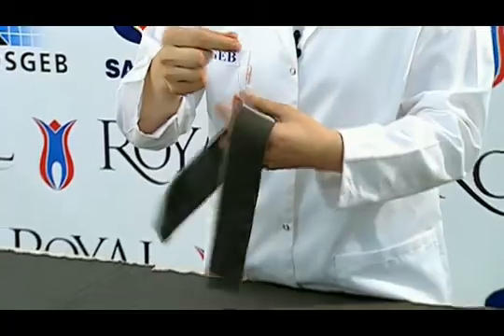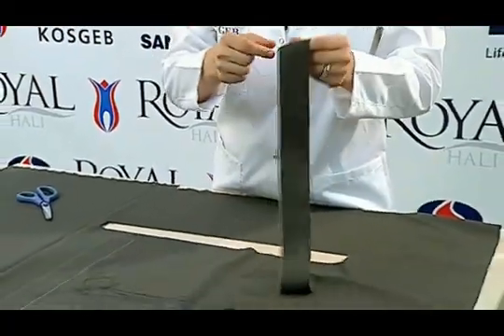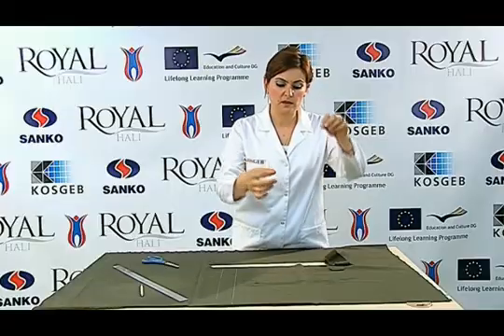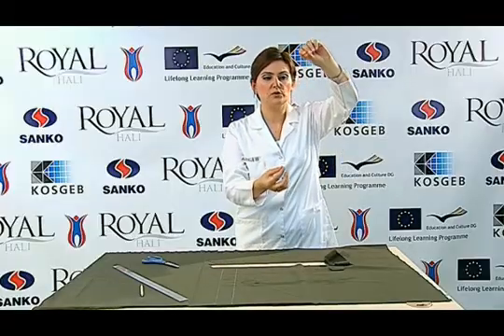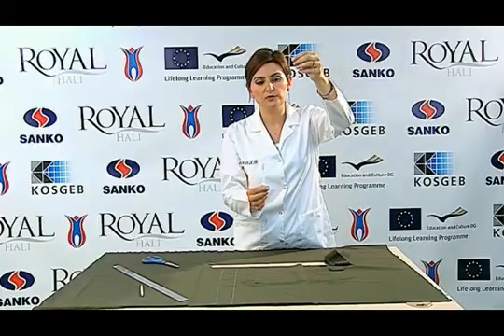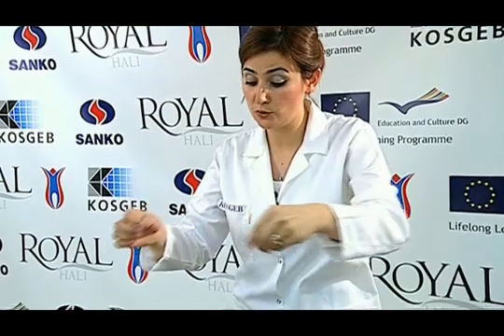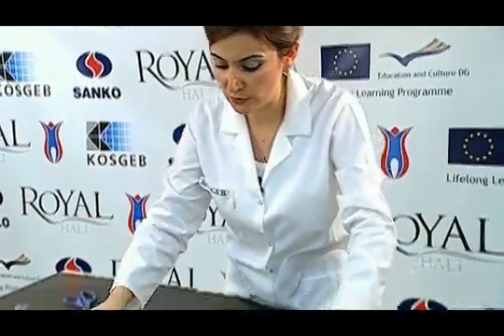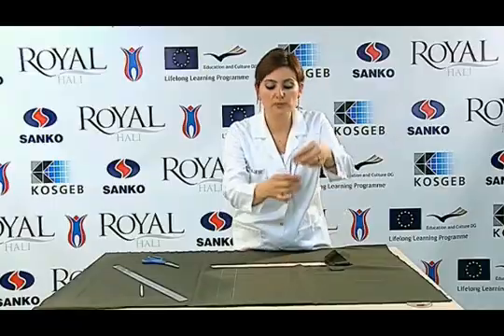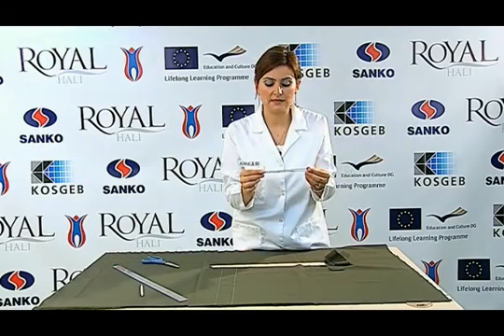We find the actual length of the yarn that is removed from the 50 cm long sample. Since the length belongs to 10 yarns, the obtained value is multiplied by 10. Then we weigh it in a precise balance.